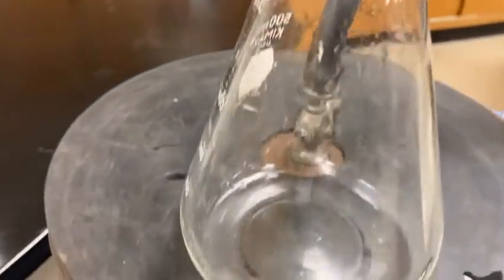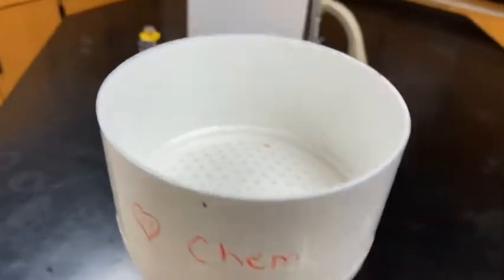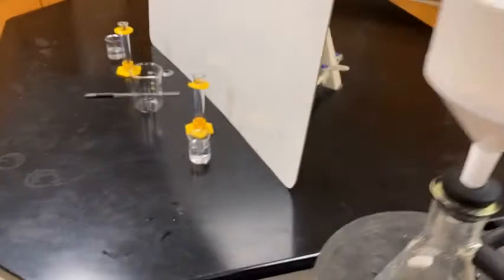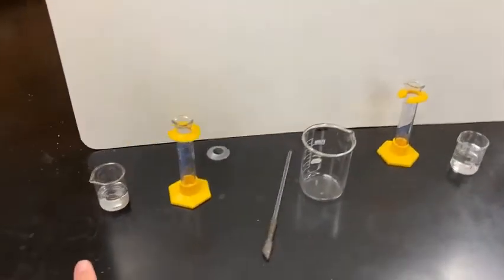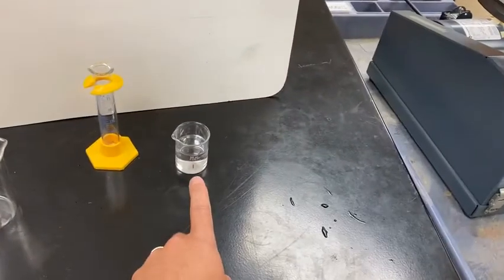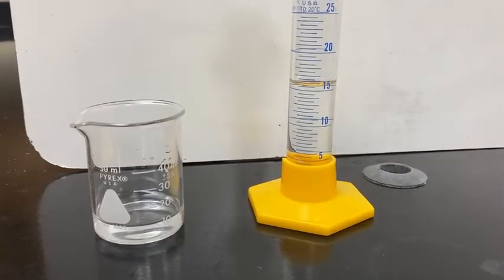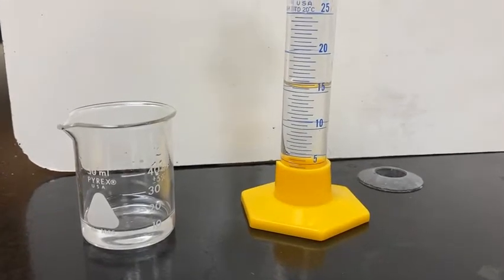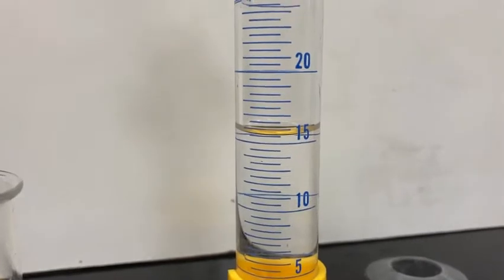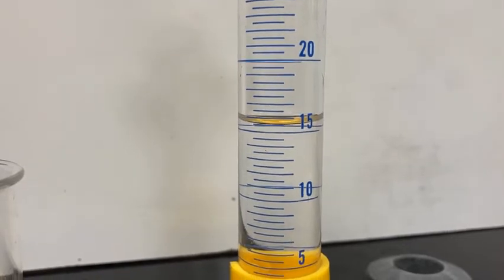And what it's doing is from the vacuum, you can see on the bottom that the water that I squirted in there is being sucked through. And this, in essence, is what we're going to use. Wow. Oh, it's a really good suction to get our precipitate. So I'm going to shut this off, and we're going to come over to the side. So on the left, I have the unknown concentration of sodium carbonate. And on the right, I have the known 3 molar strontium chloride solution. So here's a close-up of the unknown concentration of sodium carbonate. It says in the directions we should measure out about 15 milliliters. I'm going to let you guys record what the actual volume is that we're reacting today.